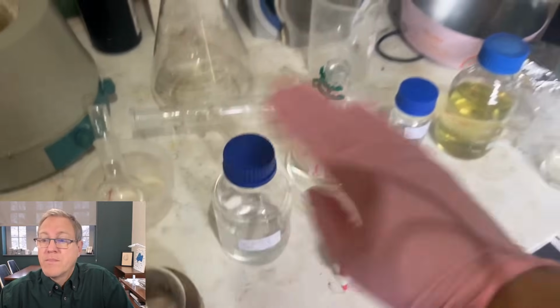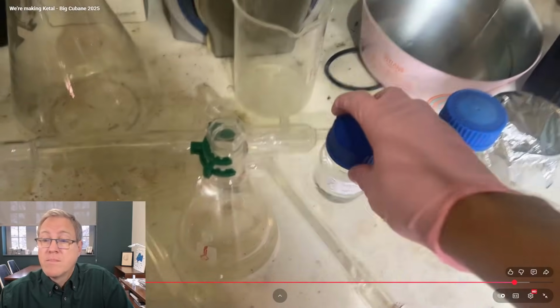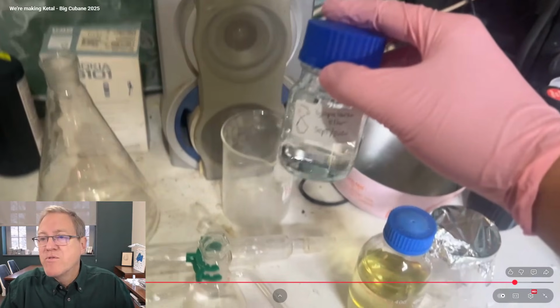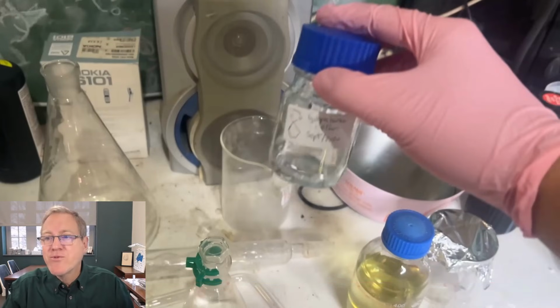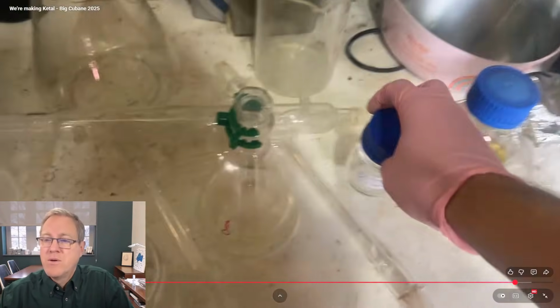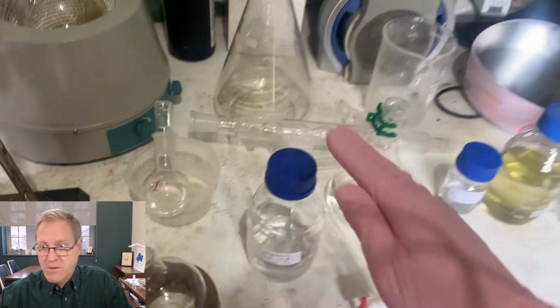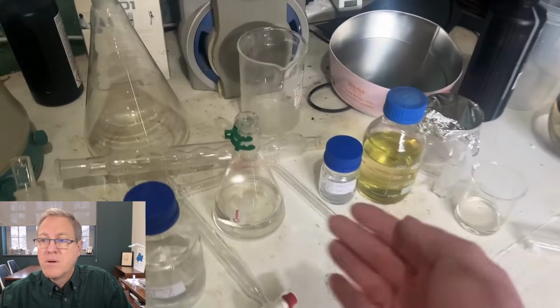132 grams is a lot more than we got previously. When we did this run before, we got about 44 grams, of which we have about... So note he's holding that bottle. Let's move it around. Note he has a full second 5-membered ring, so he knows what the structure is. He just has a structure off on that one label. About 20 grams or so left. So 132 grams is a lot more. And our yields overall were better too. We got a 46% yield this time, whereas the last time we only really got a 32% yield.